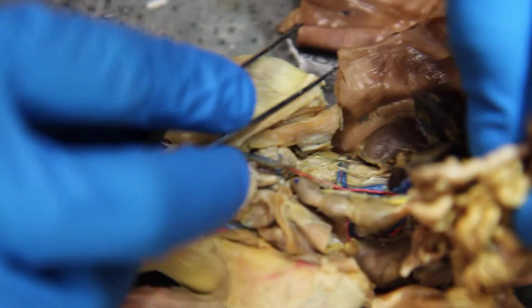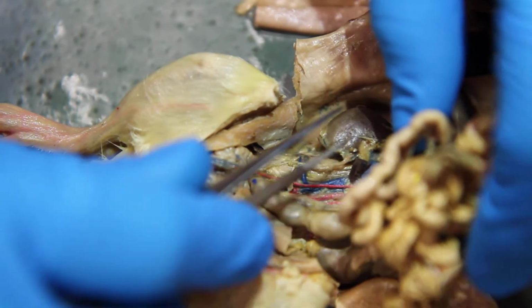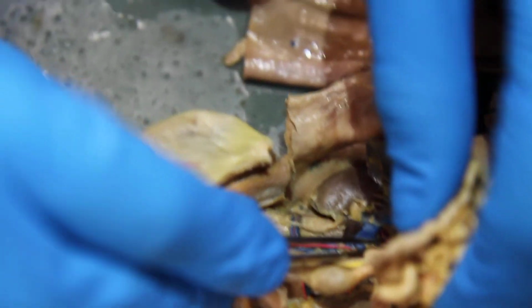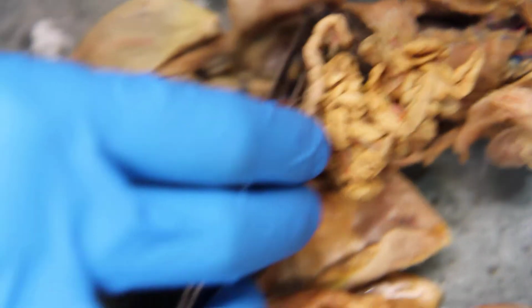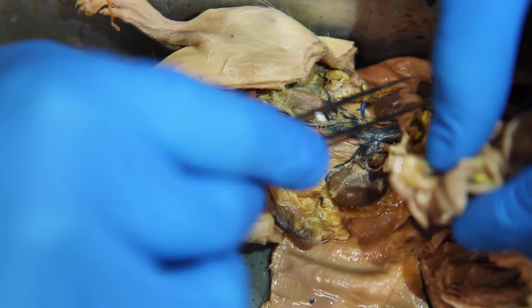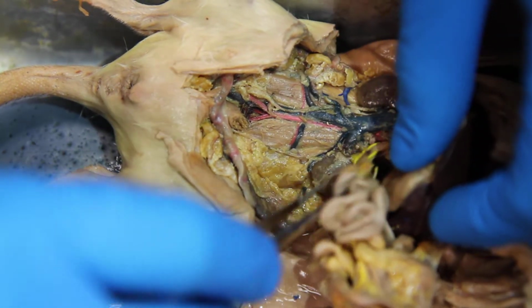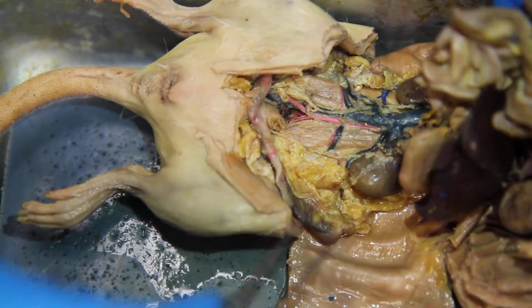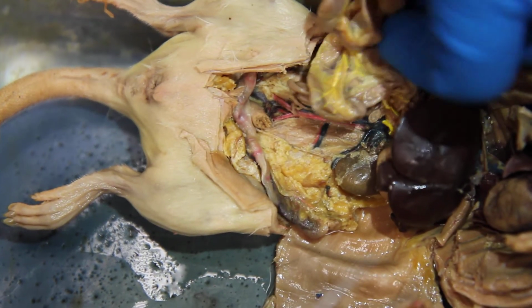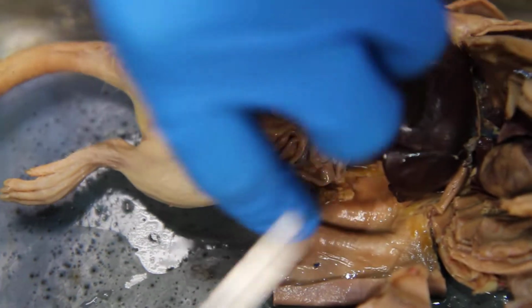So this one's switched. That's weird. It's right here. This is odd because usually it's below. Sometimes it's above. Whatever. So here it is in this rat. Right there. That's the intestine. It's going to the intestines and the mesentery in between the intestines. What's that one called? The mesenteric artery. Cranial mesenteric. Cranial mesenteric artery.